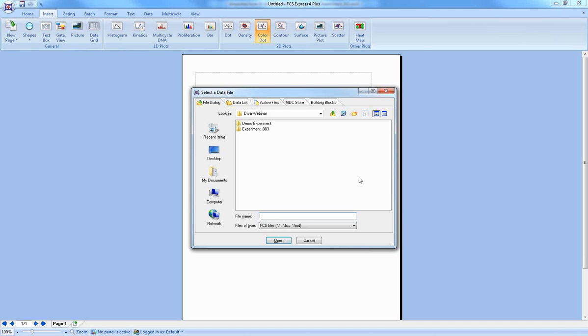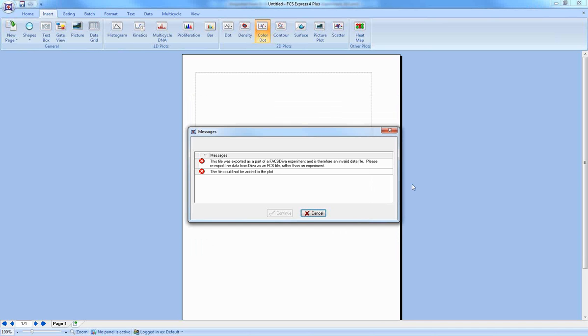When I insert my color dot plot, it's going to ask me what data file I want to use. Let's show that numerical data file that I left when exporting the experiment. What we're going to get here is a message that this file was exported as part of a DIVA experiment and is therefore an invalid data file. Please re-export as an FCS file rather than as an experiment. So by default, FCS Express will not open this file.